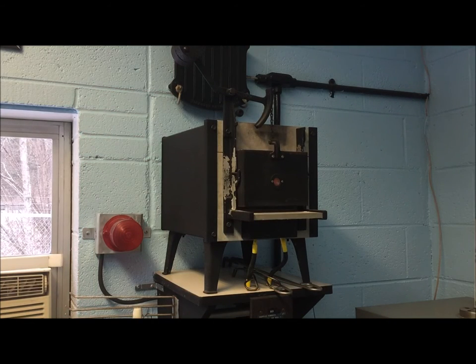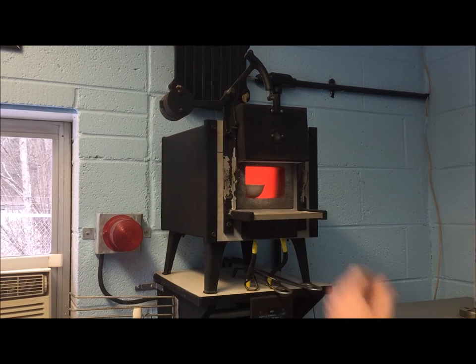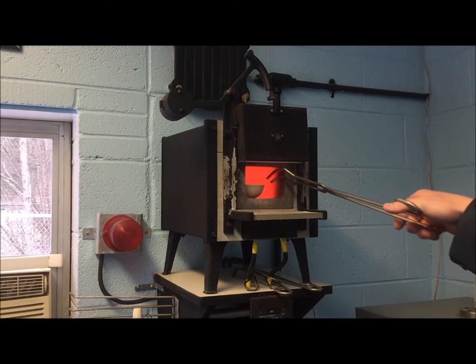The furnace is turned off. The samples are removed carefully from the hot furnace.